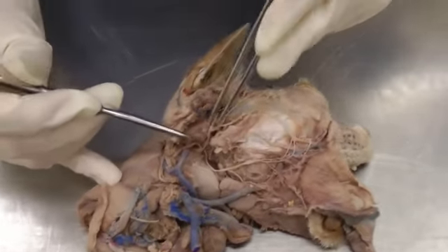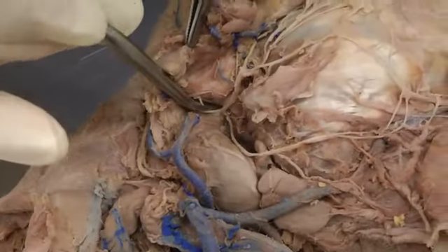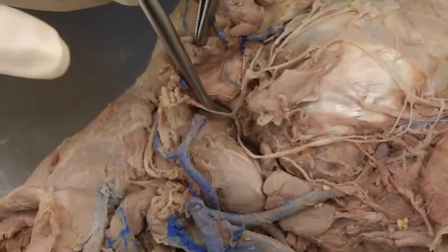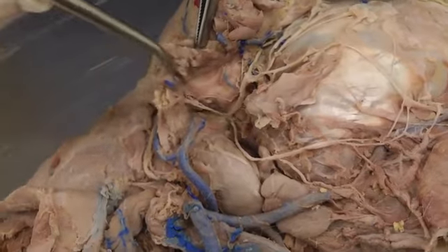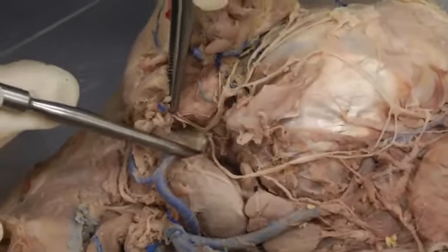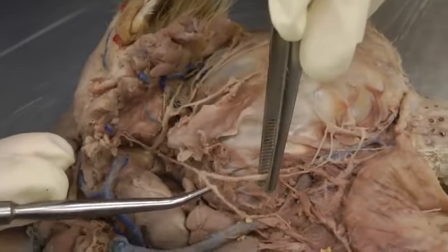So again, you're digging in this field deep to the ear, so deep to the base of the ear down here. Where the probe is would be the facial nerve, and the facial nerve is giving off these branches that we need to see. You have a few of these little caudal auriculars coming off, and then we have the ventral buccal nerve here.